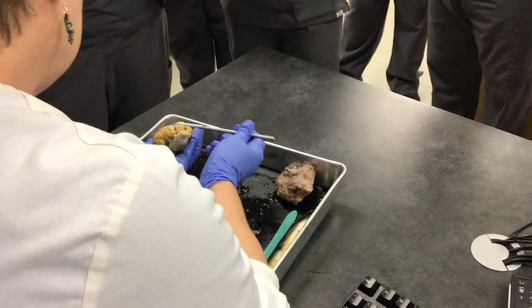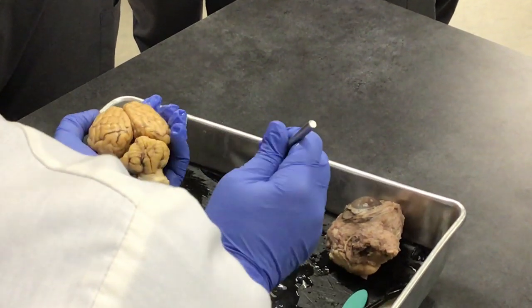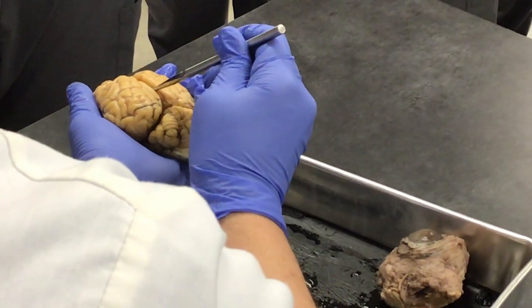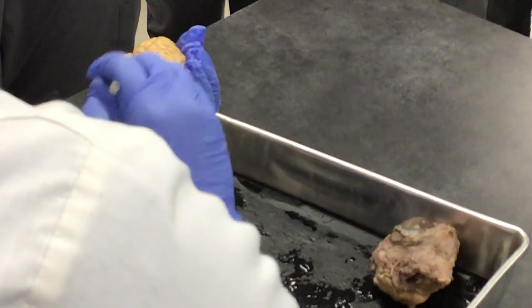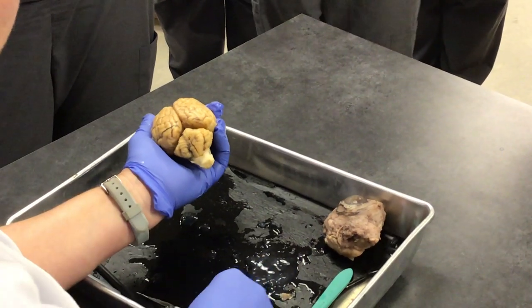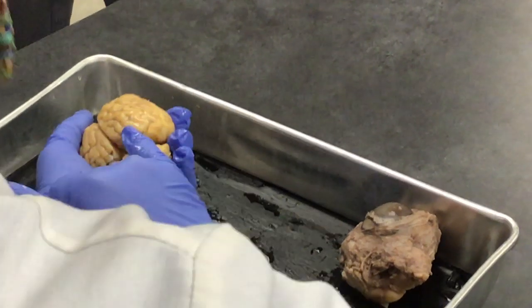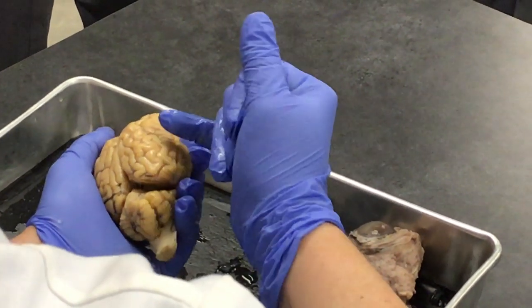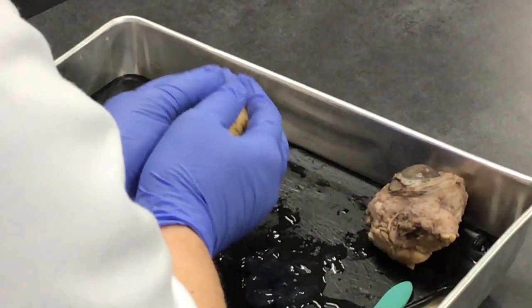These little worm-like structures in the cerebellum are referred to as vermis — V-E-R-M-I-S. And this that separates the two hemispheres is called the longitudinal fissure. All of these squiggly lines are called gyri, plural for gyrus. In Alzheimer's, this gyri becomes very smooth, and wherever you see smooth is where that brain is not firing anymore — it's not functioning. As the disease progresses, you see more smooth area, and the brain actually shrinks and atrophies.